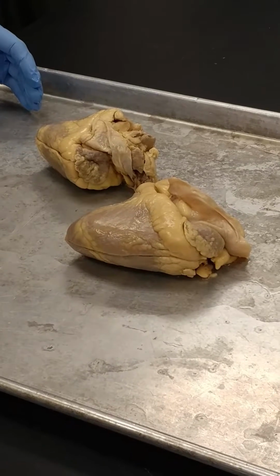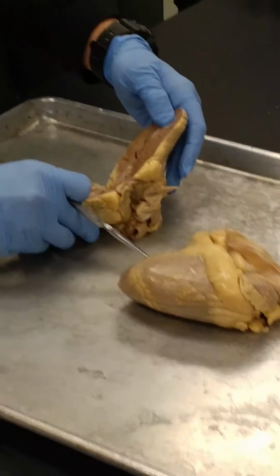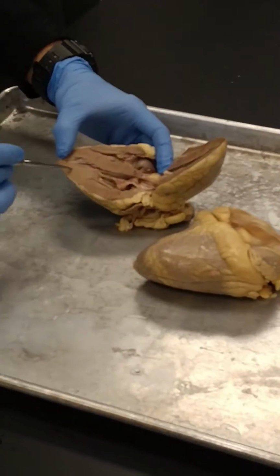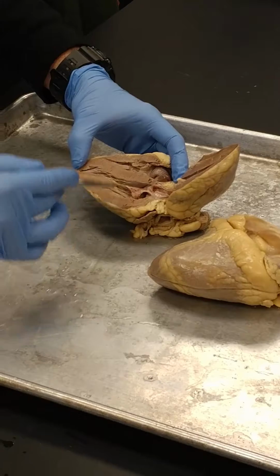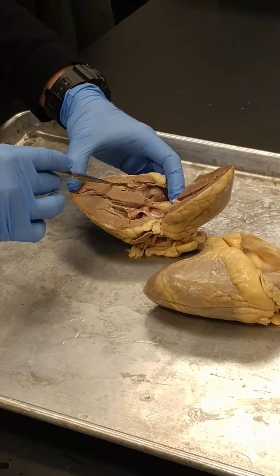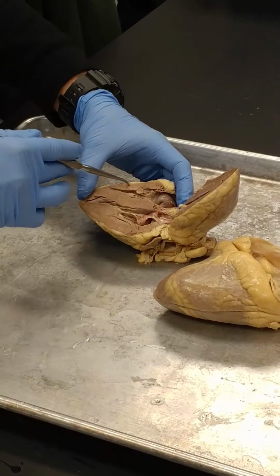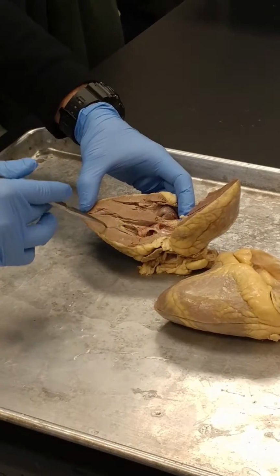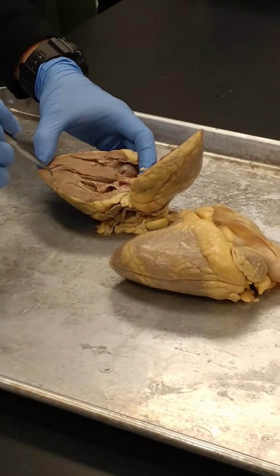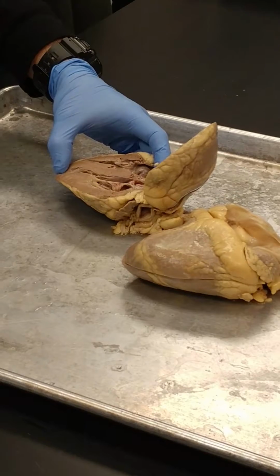Next thing, left and right atria. The atria are the two upper chambers. So let's get our bearings. The left side of the heart has a very thick wall to it. The right side of the heart has a relatively thin wall. Why? Because the right ventricle has to pump blood to the lungs. The lungs are right there, so there's very little resistance to blood flow, and the wall of the right ventricle can be very thin. The left ventricle, on the other hand, has to pump blood all the way to the head and all the way down to the feet. So this has got to be much thicker to overcome the resistance of pushing blood all the way through the body and then getting that blood to come all the way back to the heart.